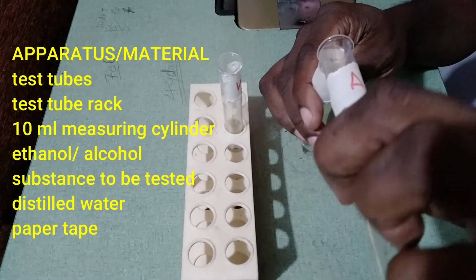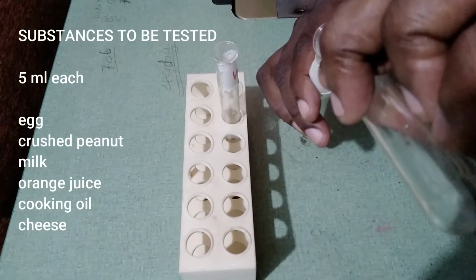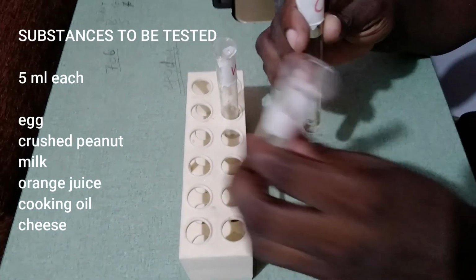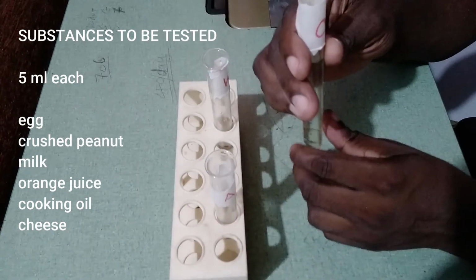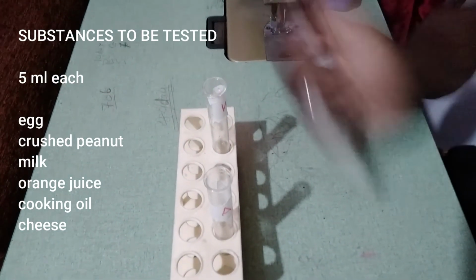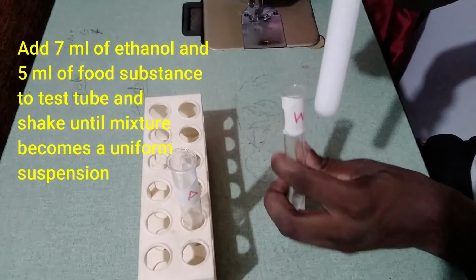Here we are adding 7 ml of alcohol to 5 ml of cooking oil, and we're going to be shaking the mixture vigorously, but we're not going to be shaking it as long as it should be. You will observe the difference in the color when we would have shaken it, but not as long as it should be shaken. Now this is what it looks like, not properly shaken.